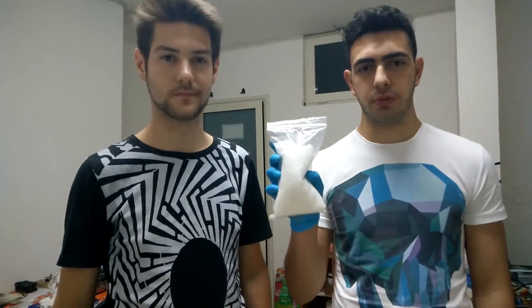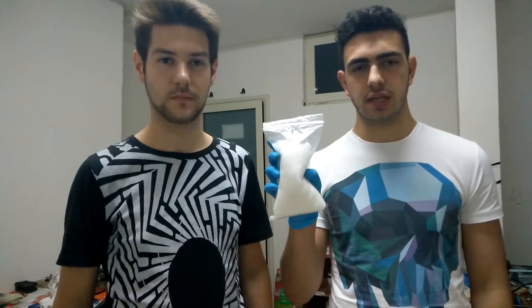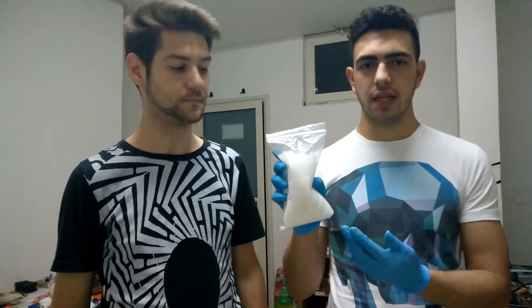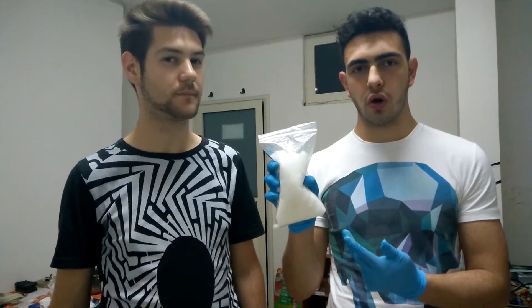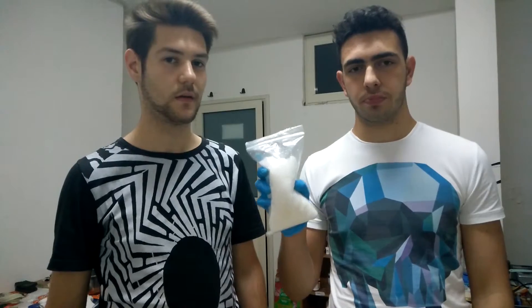The last thing we want to mention is that we can also use very pure sodium acetate for this experiment. In fact, the one we used in this experiment is impure, as we said. And with pure sodium acetate, which we can see is white in color, the product is even more pure.